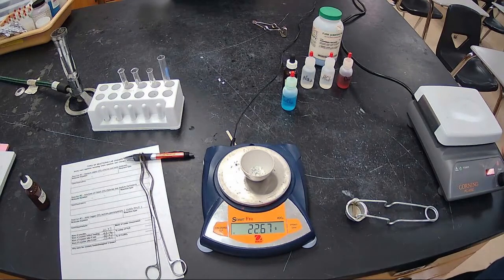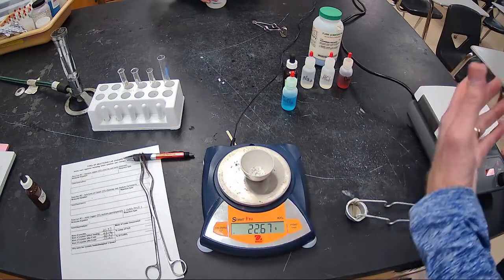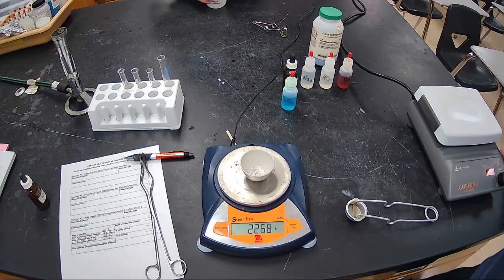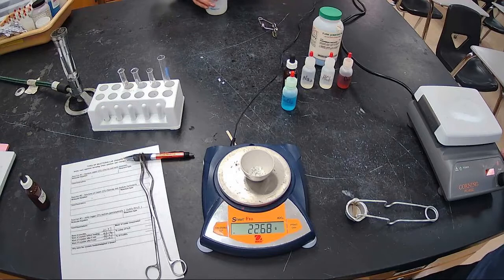Well, theoretically, what should you get? So we have the copper sulfate. We've done all 7 reactions. We just finished up with that. So now you need to make sure you get your types of reactions, identify those properly, write all your equations, include states of matter, and balance them correctly.